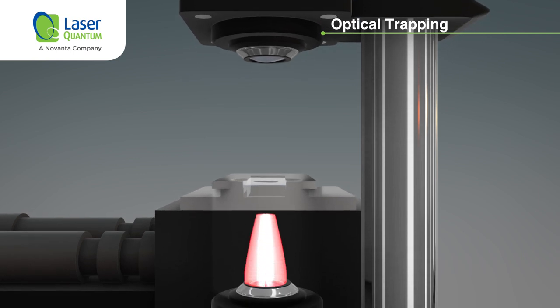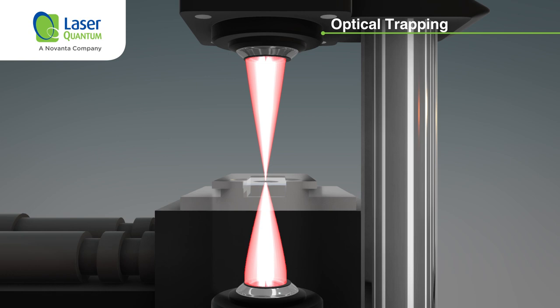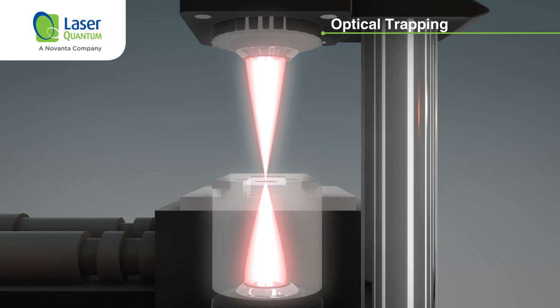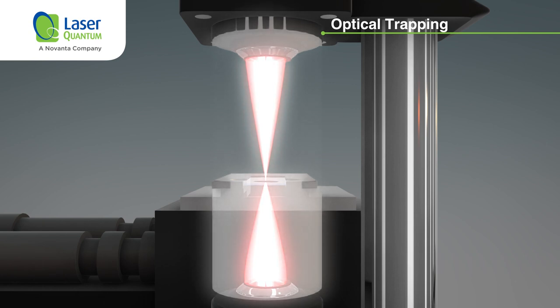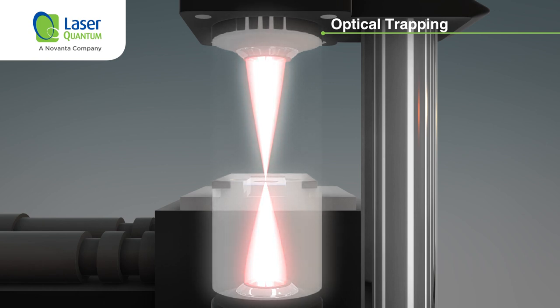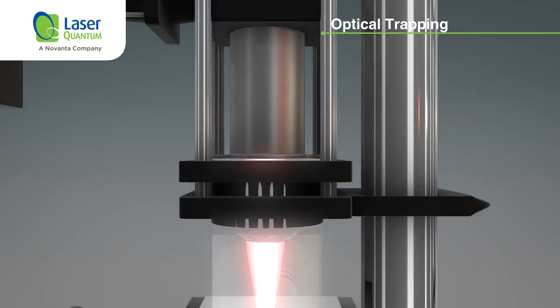The expanded beam is focused through an objective lens onto the sample. A condenser lens opposite the objective focuses either a white light source for imaging or an excitation source for spectroscopy onto the sample, whilst recollimating the trapping beam.